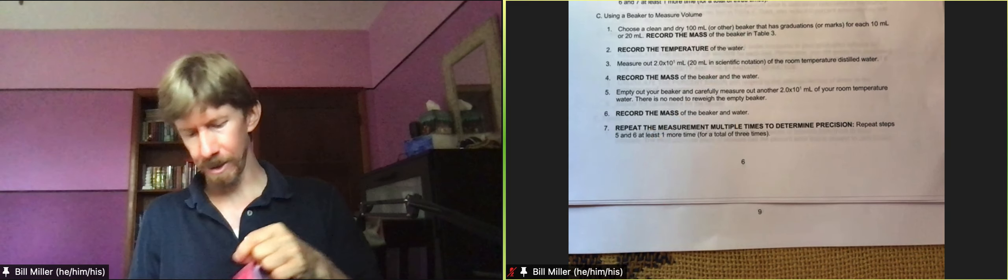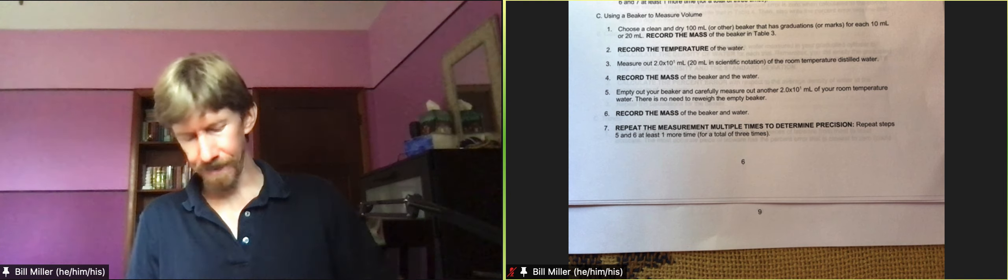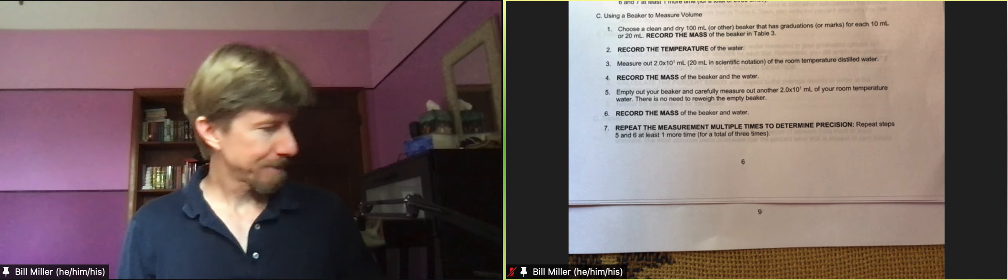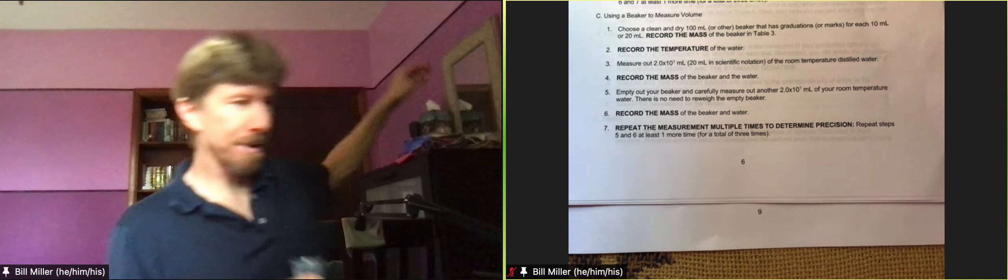It was wet, so I've just got a piece of cloth here. I'm going to dry it out. You do want it to be dry this time. And whenever it says dry in the procedure, you want to get it there. So let's put that up there. It is dry.